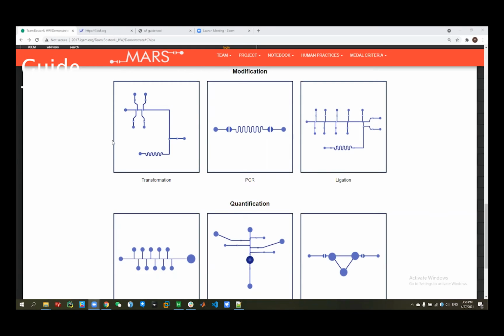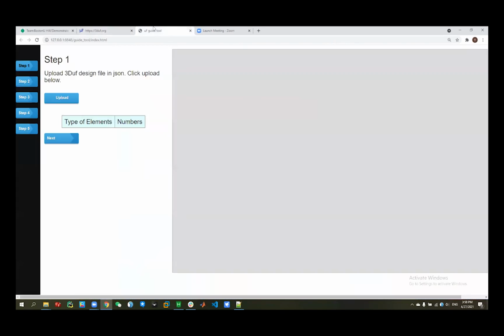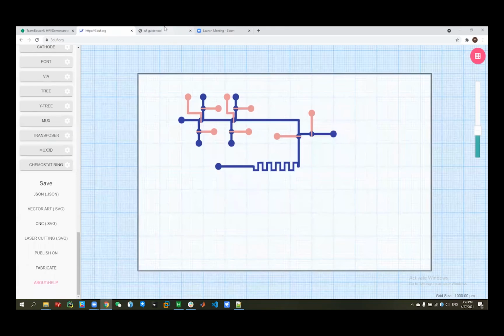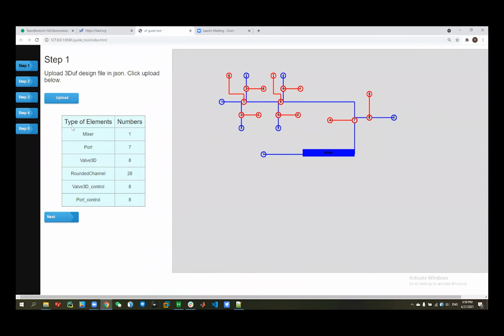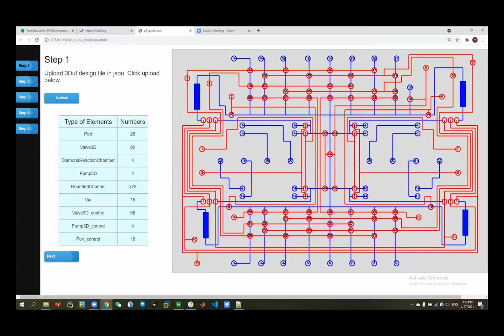From the description in the MARS repository, for example, transformation, we can get the design of it in 3DuF. Then we can download it as a JSON file, and we can upload it into our guide tool. So here we just open it and it looks the same, right? And then we also have done some analysis. So here we can upload another more complex device, and you can see.